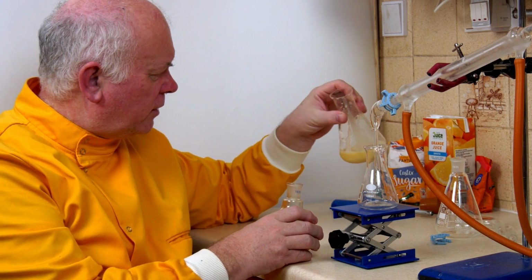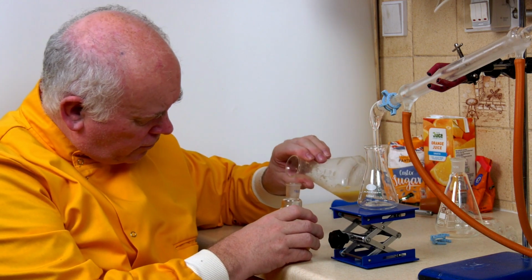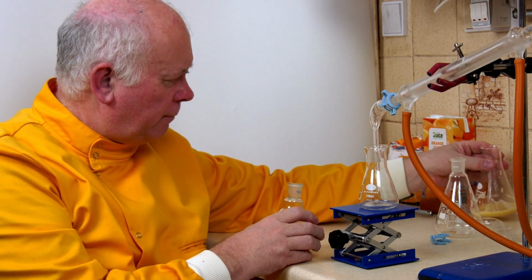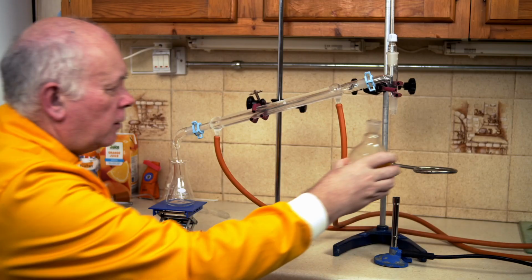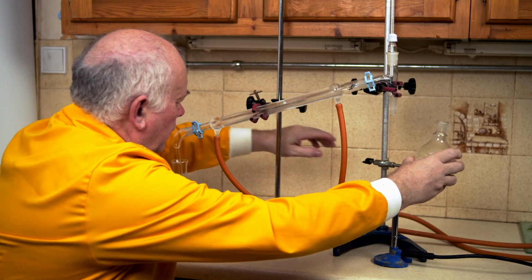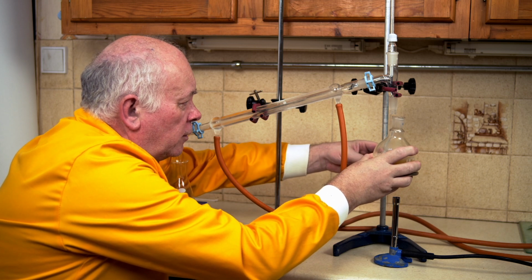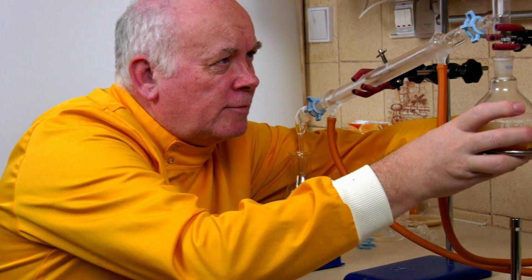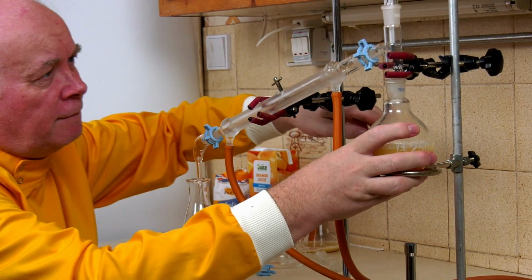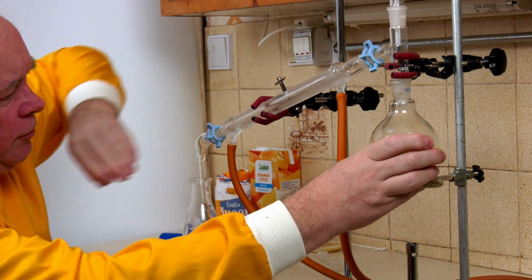Well, it's getting a bit thick at the bottom. I may not really want all of that really thick liquid. No, I think I'll leave that. And now I've got mostly orange juice there. And what we're going to do is connect this up. I'm going to lift this now onto this and make sure it's got a good connection.